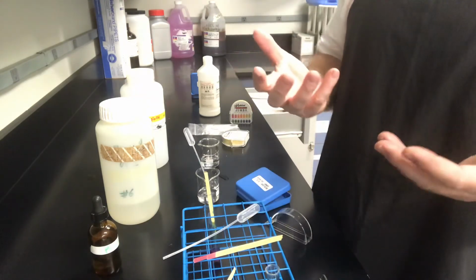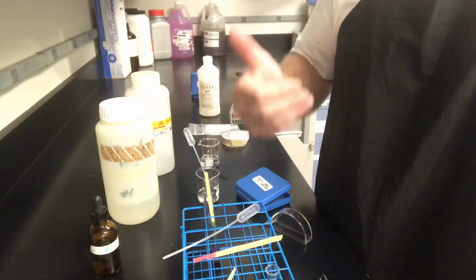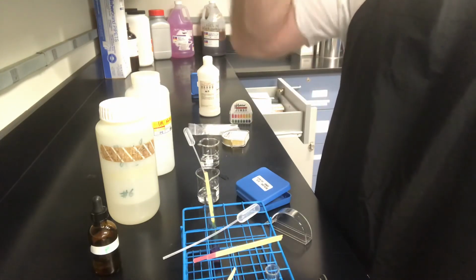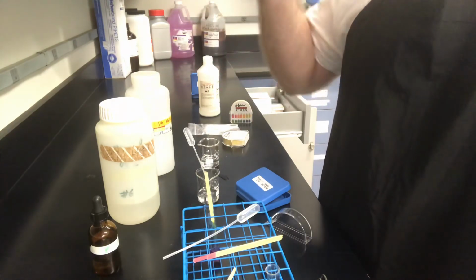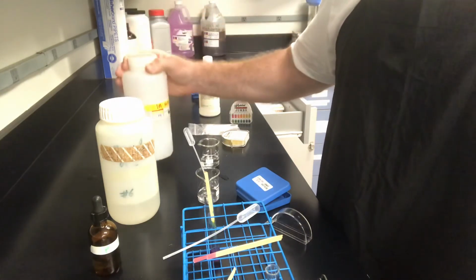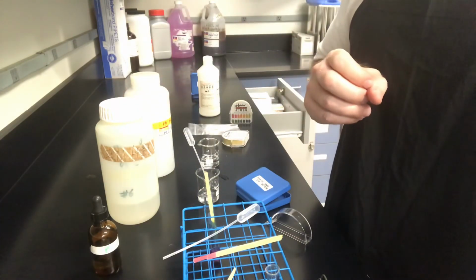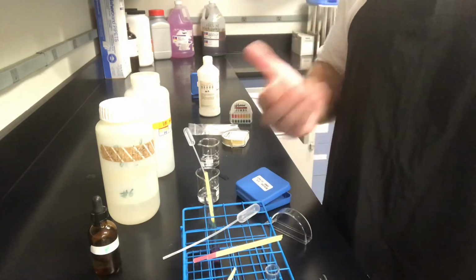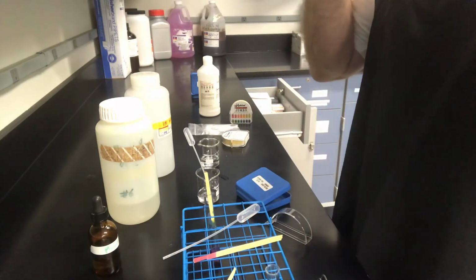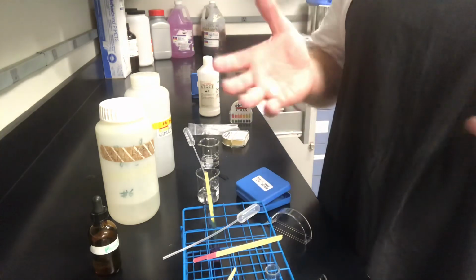Again, it depends on the size of the drops. And I also know this is a little bit weaker than 1 molar. So it could maybe be another drop or 2 because of the weaker concentration. Actually that's about 3 drops. The concentration of this being really around 0.91 makes an extra 3 drops needed to neutralize. So, based on that, the data makes sense. It took a little bit more than twice as much of the half concentration, and that's what the results showed. So we were in the ballpark, but it's not exact because we don't have what are called burettes.